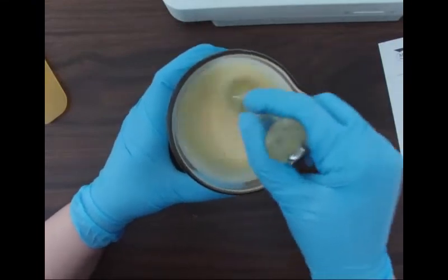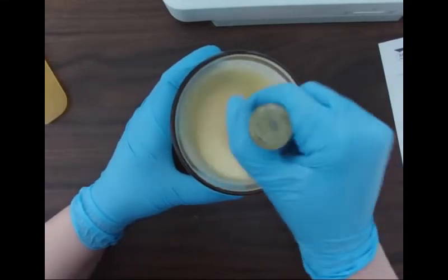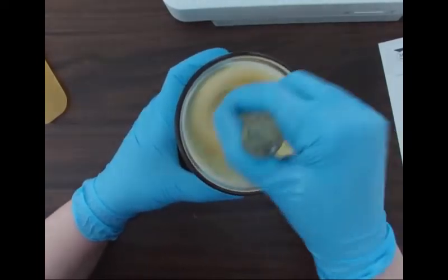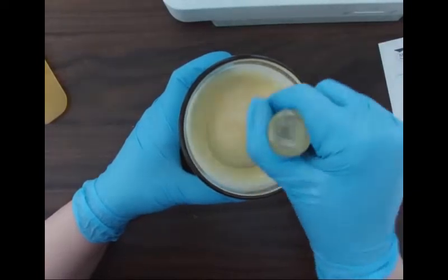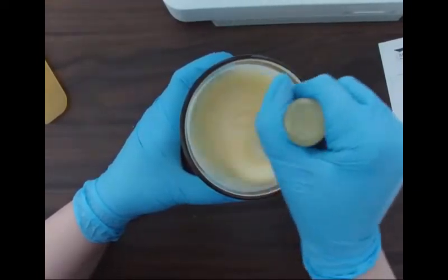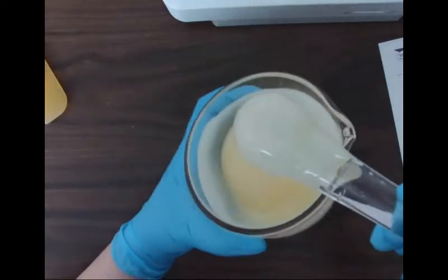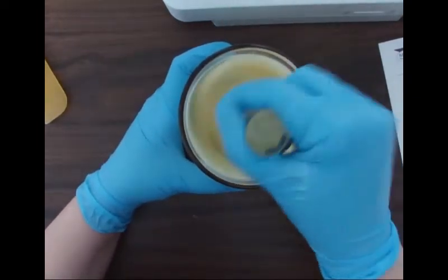Okay, now because it is quite cold, it takes a while to go into gel form, so I just have to mix those two together. As you can see, it's still quite liquidy. We just mix it and mix it until it goes into a gel. As you can see, the geometric dilution is not necessary because it stays liquid until it starts to go. So that's me just trying to show you there that it is quite runny, almost pancake batter-esque.